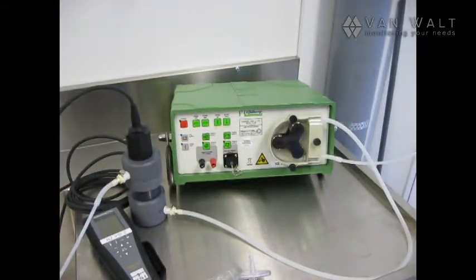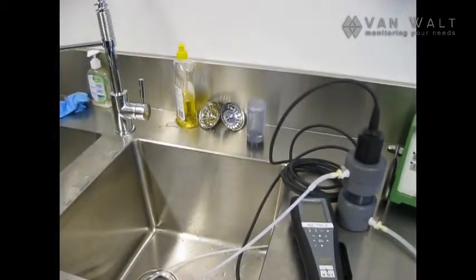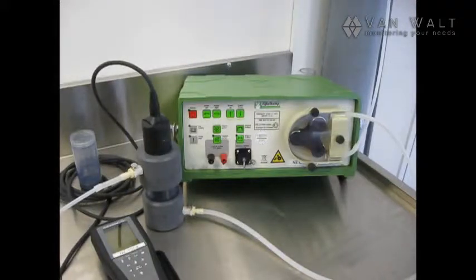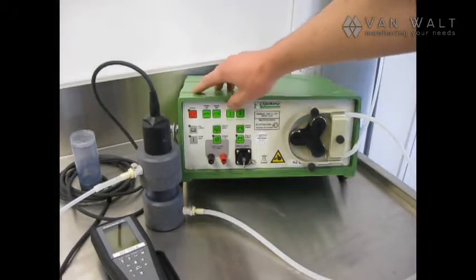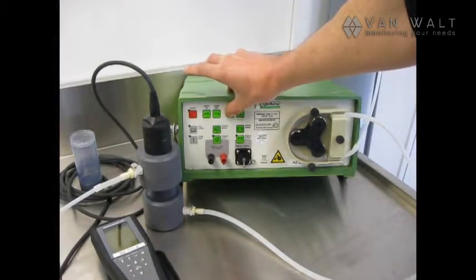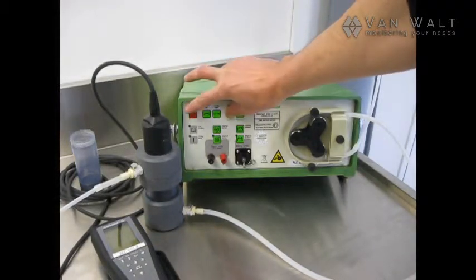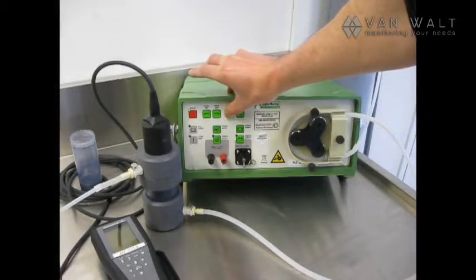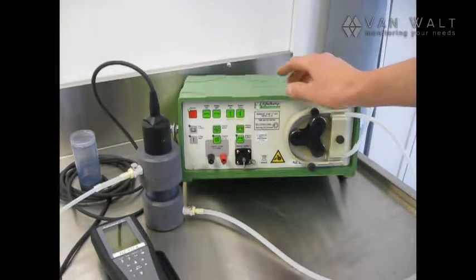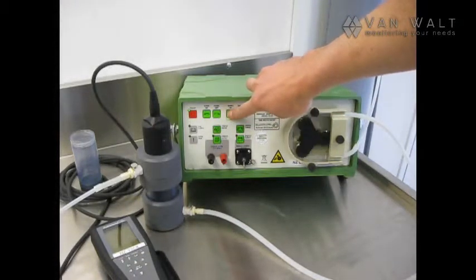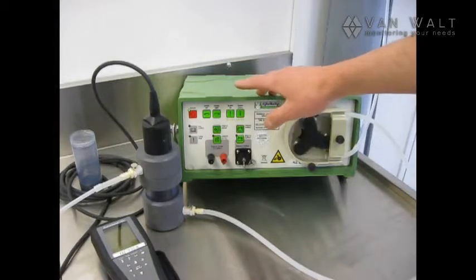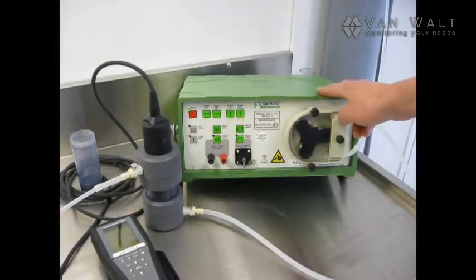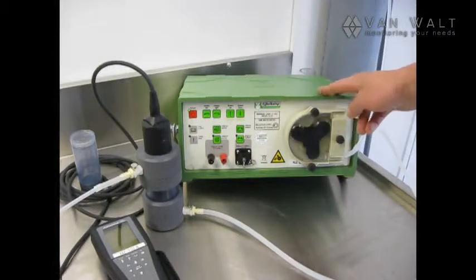And for my purposes, we're just going out into the sink. Okay, so we're ready to start the pump. What I'm going to do is start it in memory mode. We've already made a video of how to do this, but I'll just go through it again. I'm going to hold my memory button down. This is memory A here. And I'm going to press the on button and I'm going to wait for at least three seconds. Okay, we're now in memory mode. And now I can dial the pump up. And this is going to allow us to pause the pump at any time and restart it at the revolution and direction that we want it in. So we're now pumping from our well.